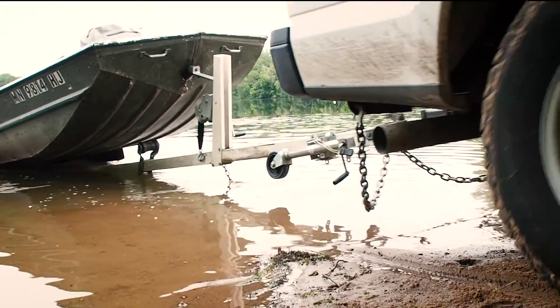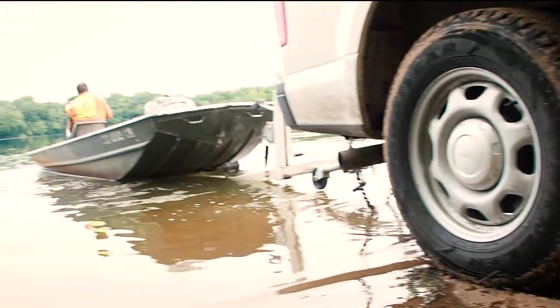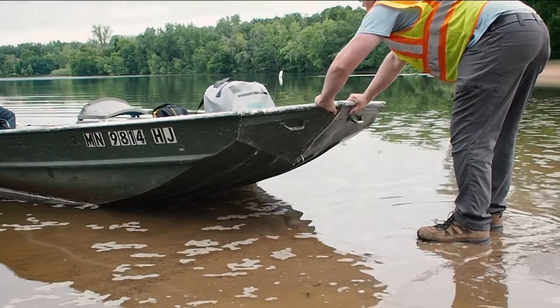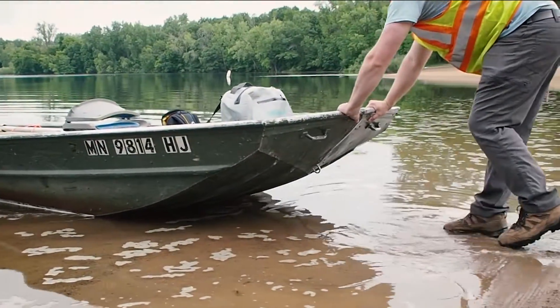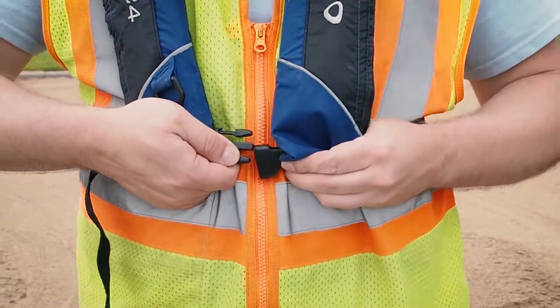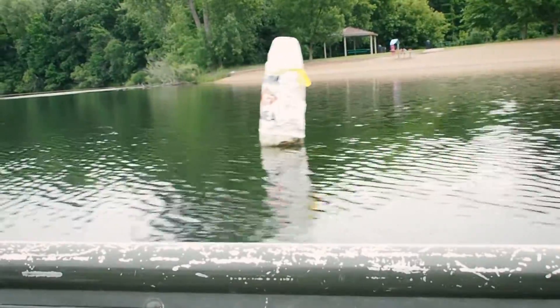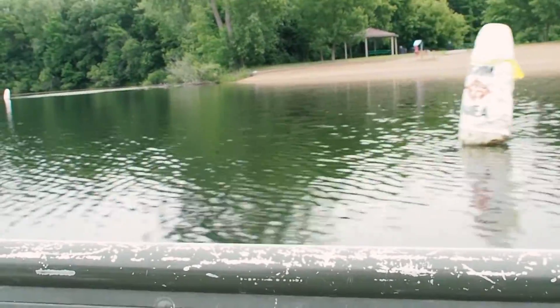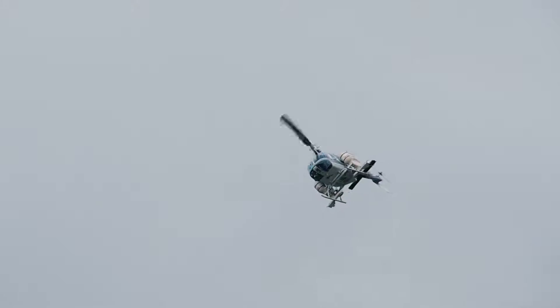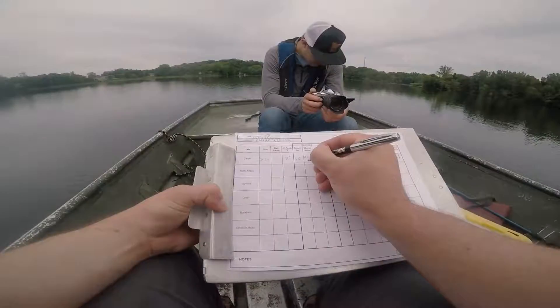Throughout the year, Ramsey Washington Metro Watershed District collects lake water samples from around our district in order to gather data and use it to analyze where we are at with our water quality management efforts and goals. You may have seen us on the water and viewed this process from afar, but we wanted to give you a first-hand experience. So buckle up your life jackets and join us.